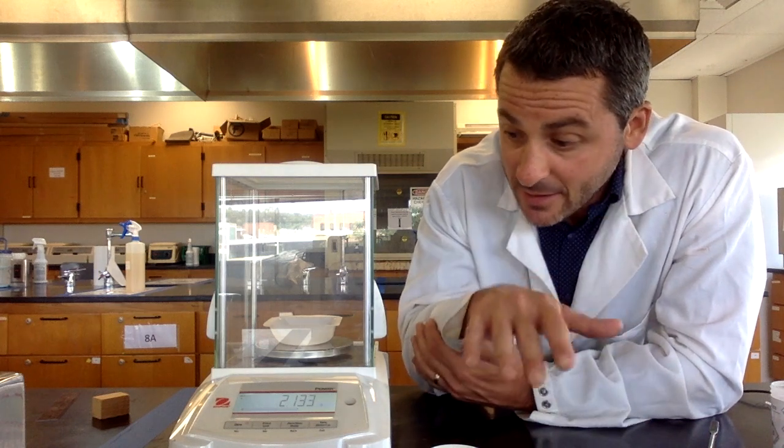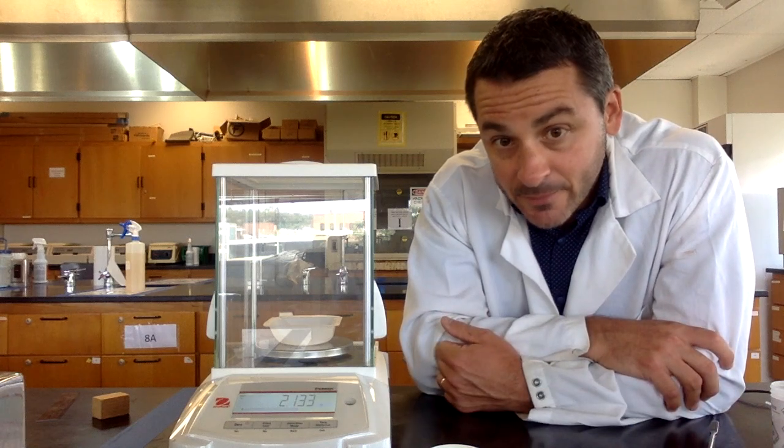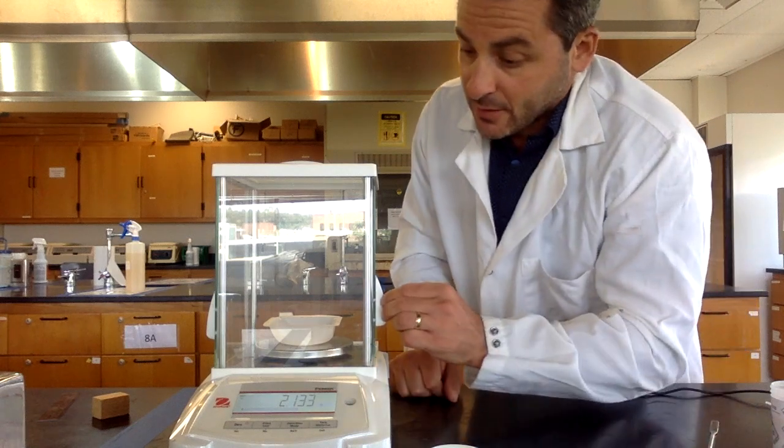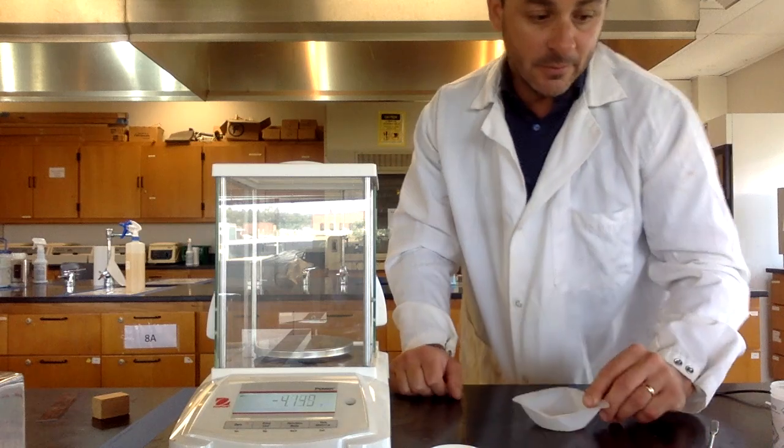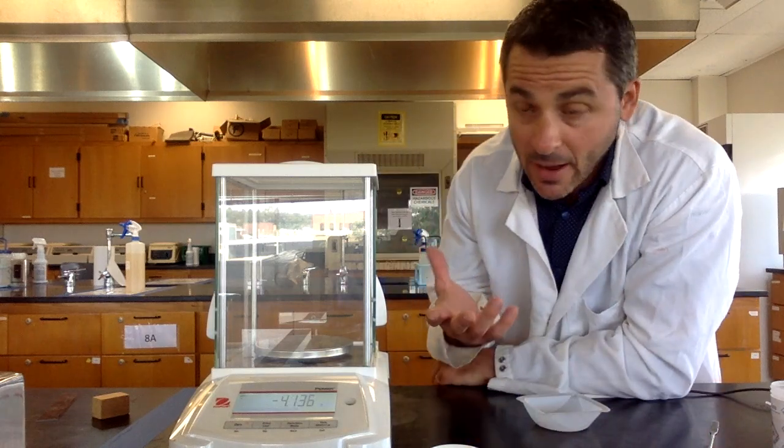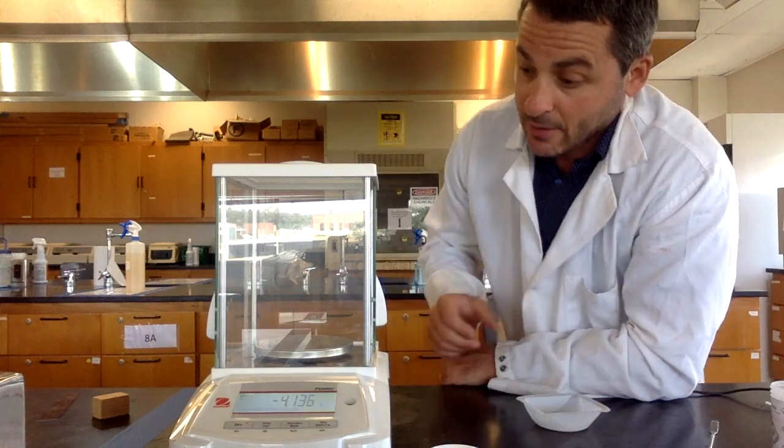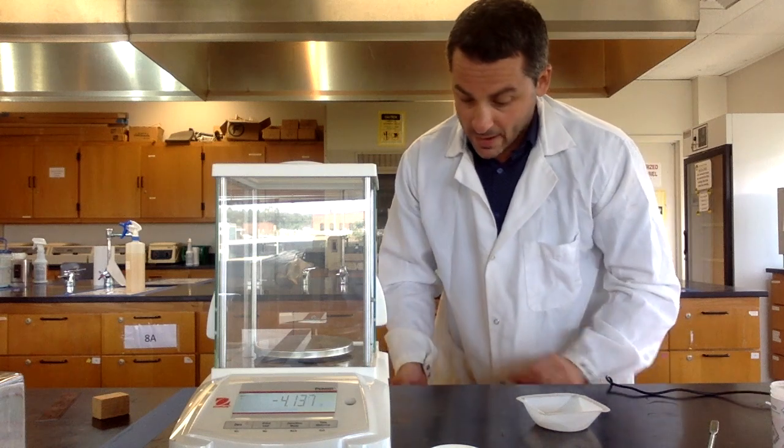You could also do this with a beaker of some sort or a container, whatever you have. You can put the beaker on there, weigh out the beaker.